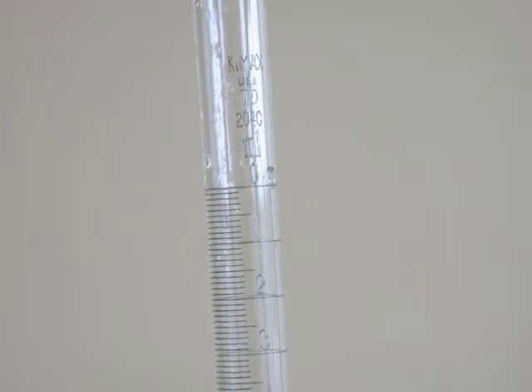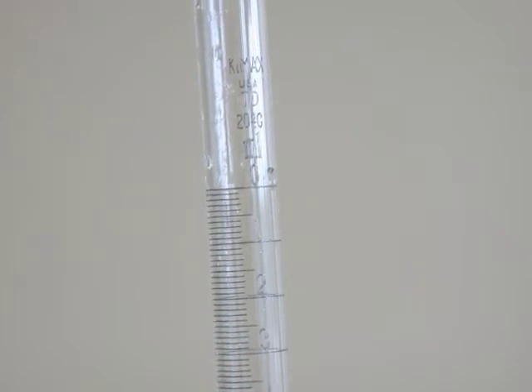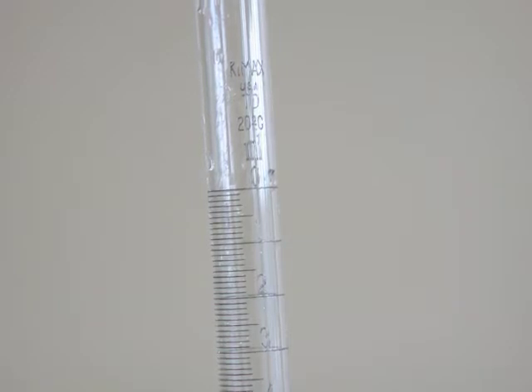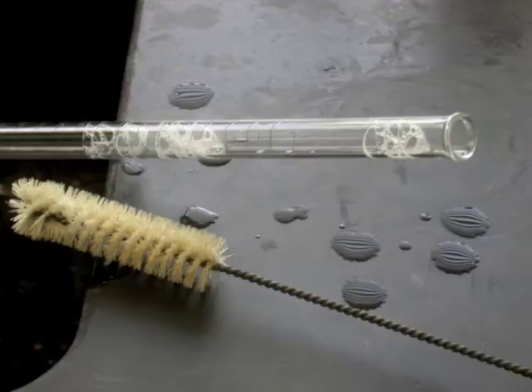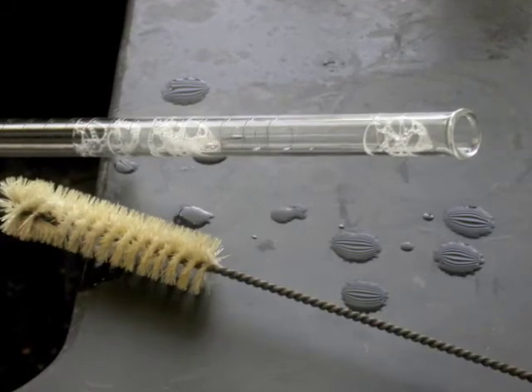then clean the burette with detergent and water. Use the long-handled brushes that extend the full length of the burette. Put some detergent and water on the brush and scrub the inside.